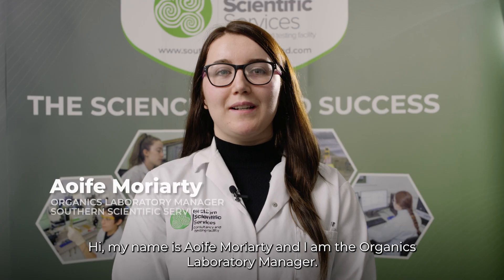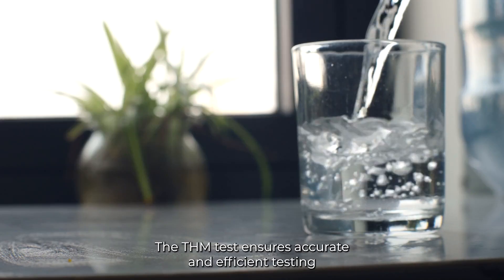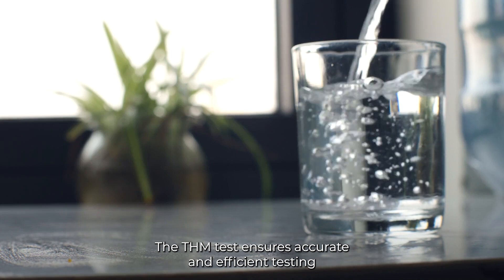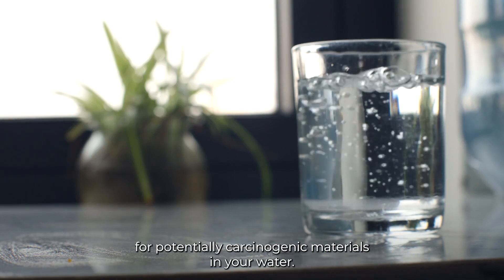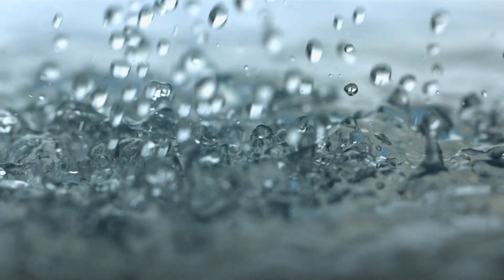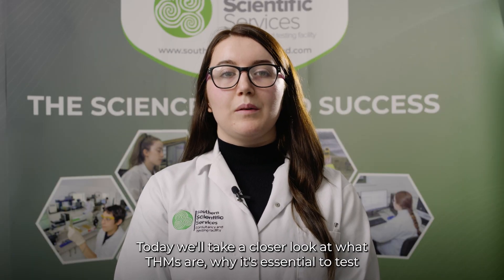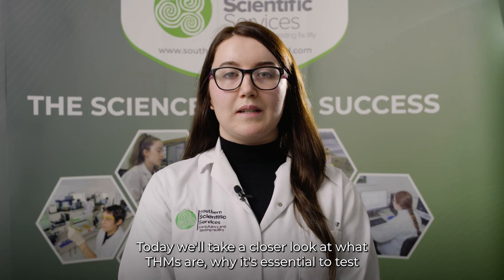Hi, my name is Aoife Moriarty and I am the organics laboratory manager. The THM test ensures accurate and efficient testing for potentially carcinogenic materials in your water. Today we'll take a closer look at what THMs are, why it's essential to test for them, how the testing process works, and understanding your THM test results.